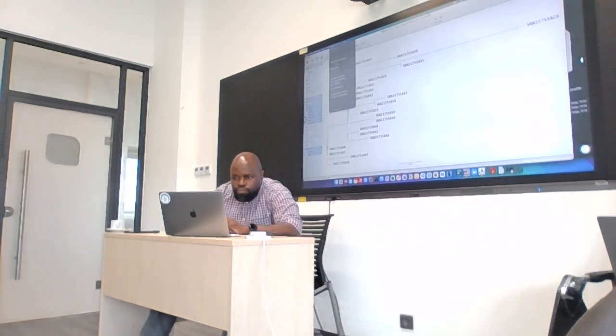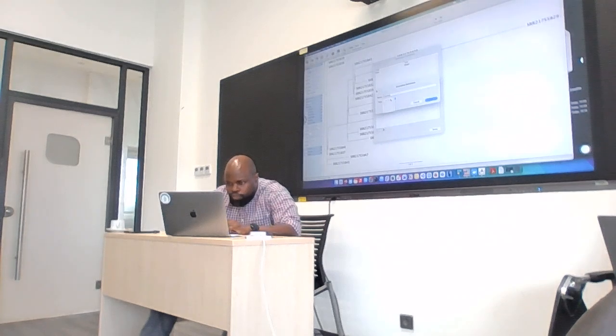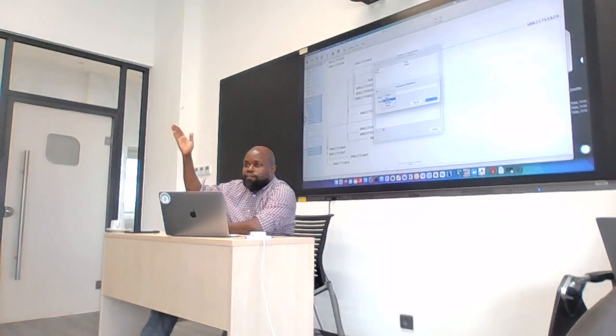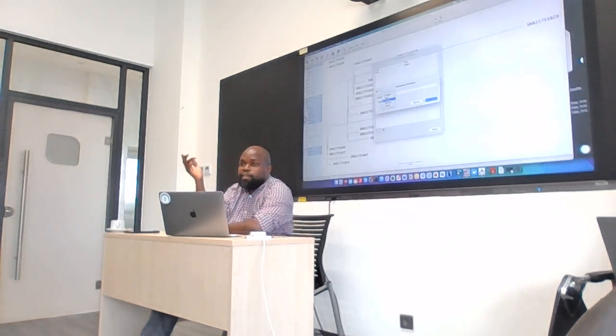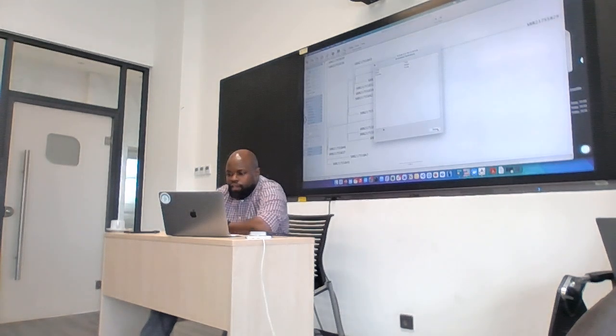So I'm going to create a new annotation. I'm going to call it country. And I'm going to say that it's a string. There are different data formats. There's an integer, which is a number. There's real number, which should be able to accept decimal places. There's a string. There's a boolean. Boolean is true or false. And then you have a range, which is giving a range of numbers. So mine, I'm going to say it's going to be a string. And then I say okay. And then I say done.